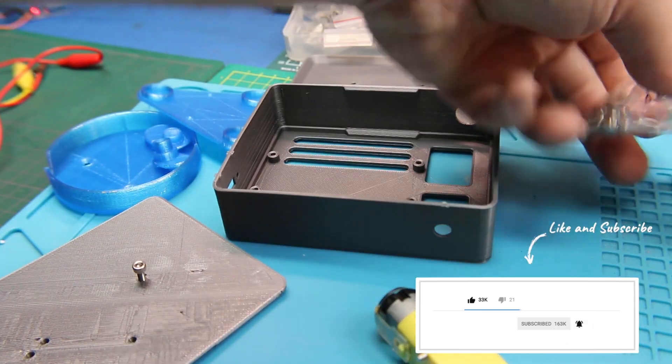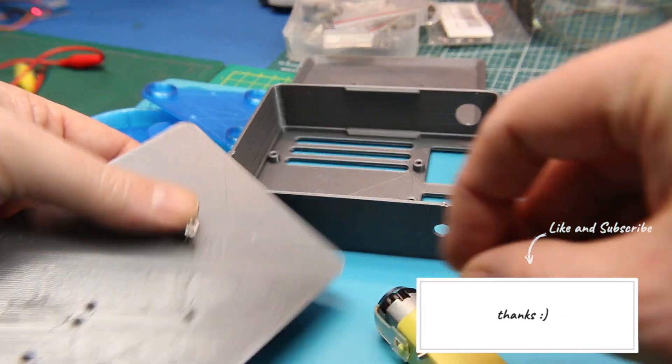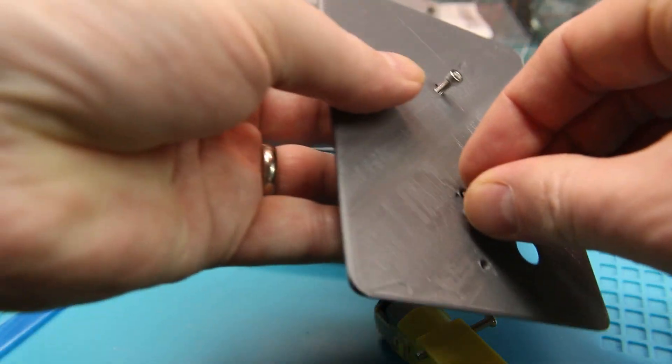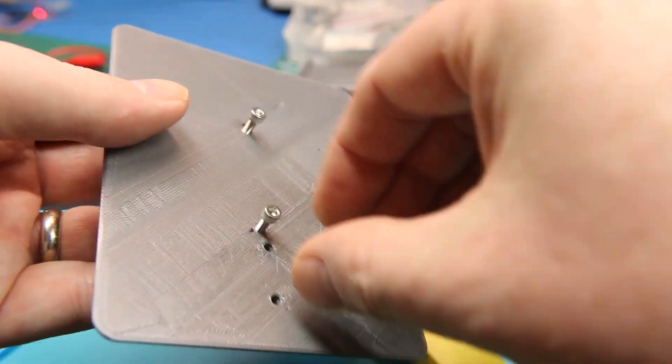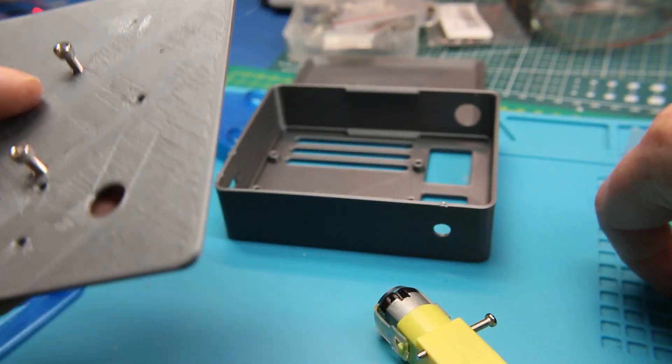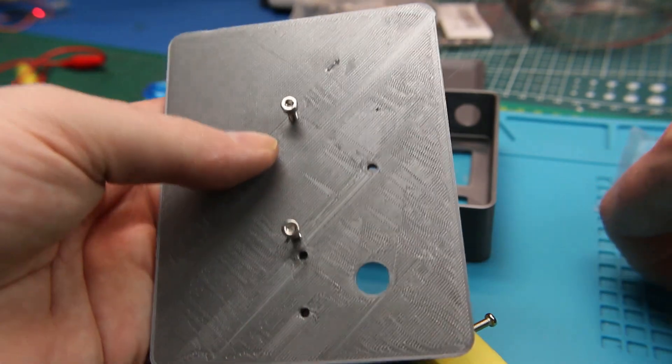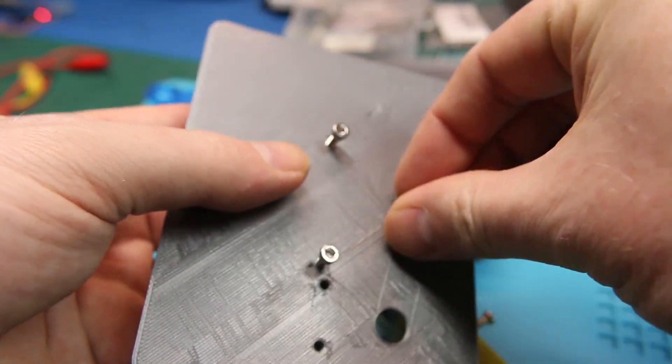The bearings I actually already had on hand. When I first saw this tutorial, I had gone to eBay and ordered them slow boat. Well, they sat there for so long I forgot I even had them.